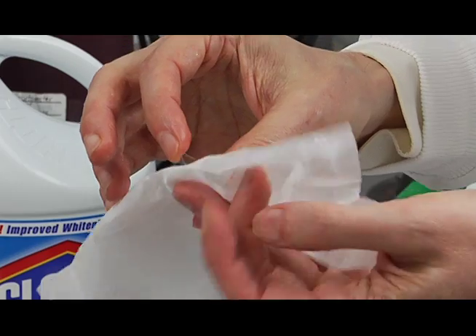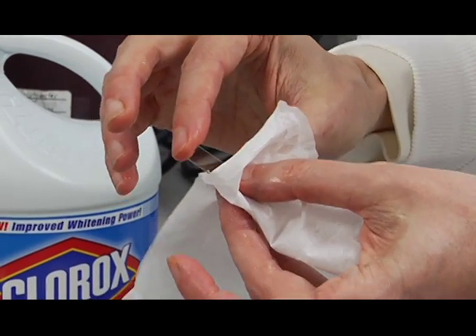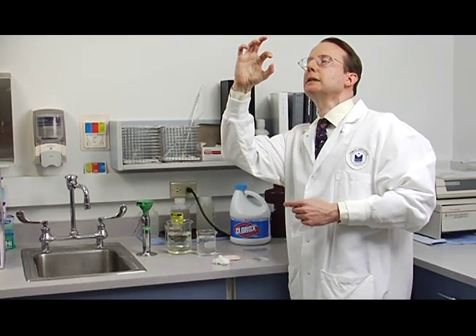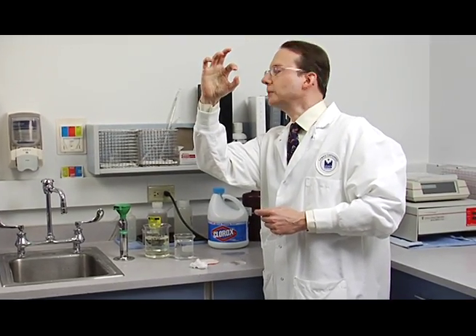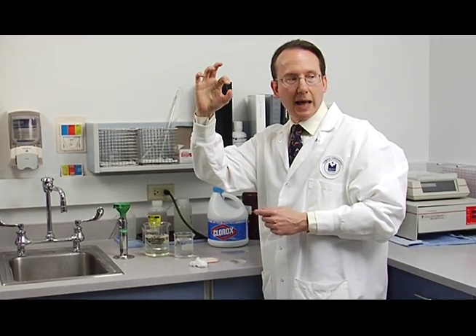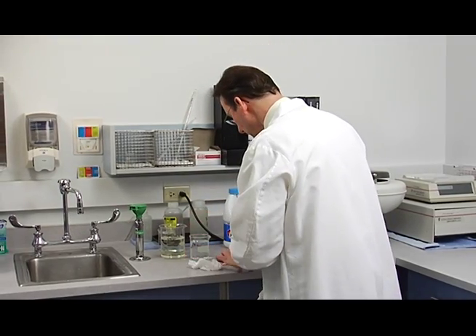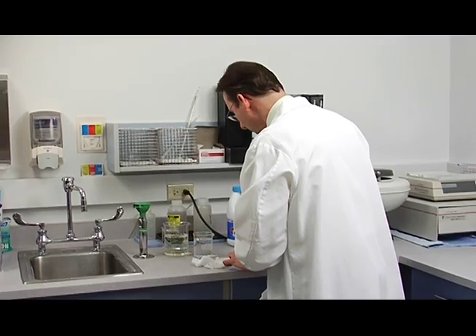And when we've finished, we'll check it for cleanliness. When you hold it up to the light, it should be perfectly clear like a window. And you might even hold it up against something black. And it should be like a flawless, mirror-like surface on there. I'm just going to set it on top of my hemocytometer here.